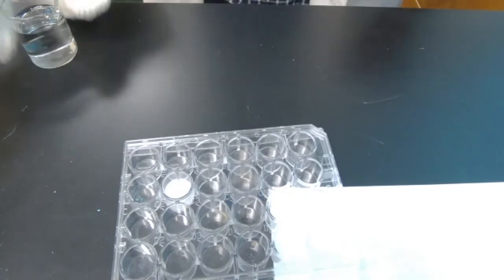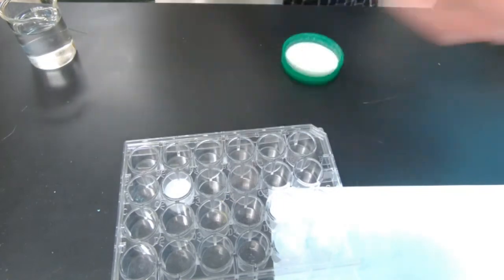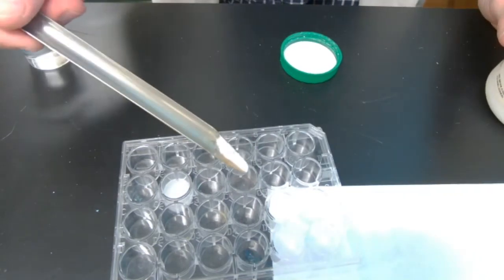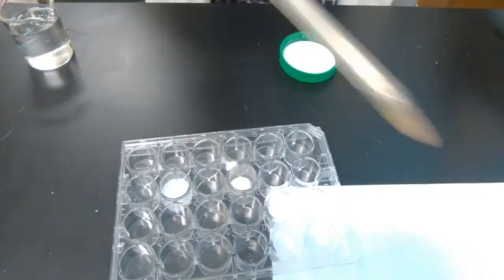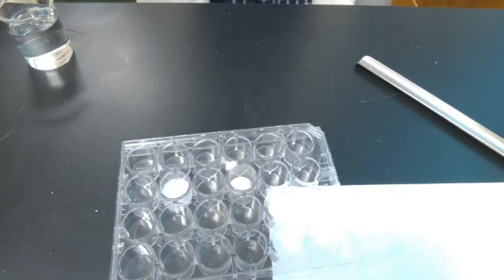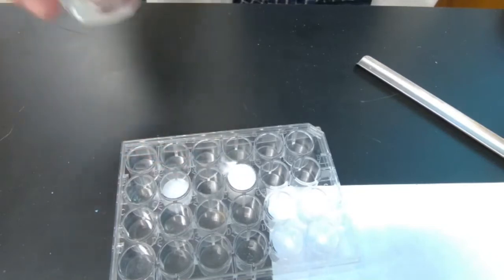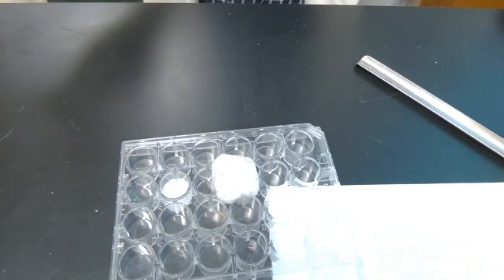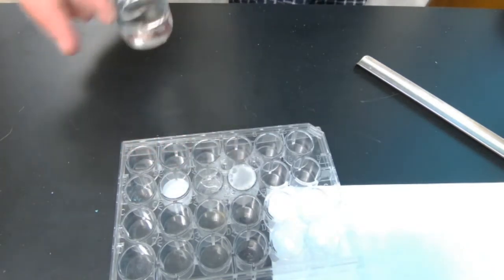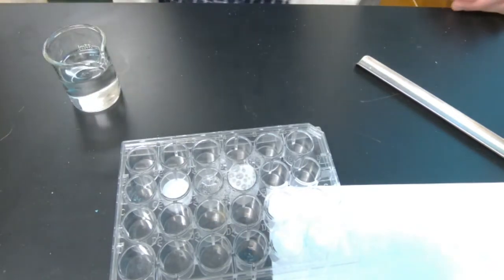So, got me some baking soda. Take off my oven glove. Baking soda is sodium bicarbonate. Put it down in there. Now what I'm going to do for you is add my vinegar. I'm not really concerned about the overflow. You got your change there. Okay, go ahead, make your observations.